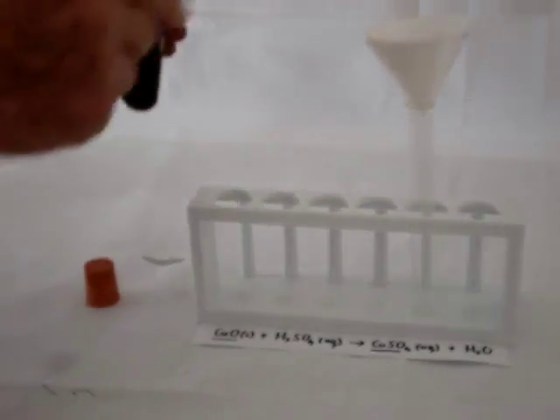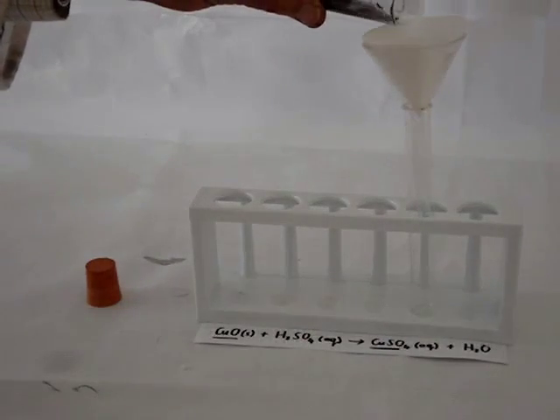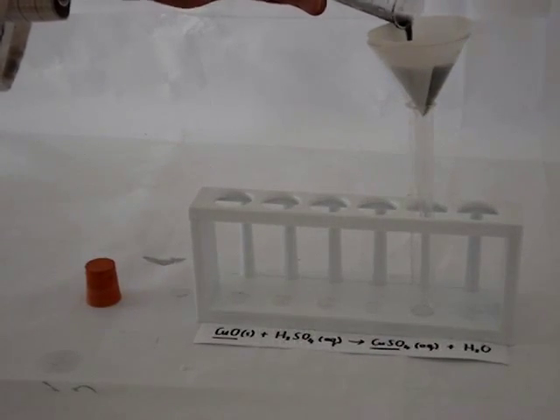Copper sulfate is a blue substance, so we should see a blue substance passing through as our filtrate.